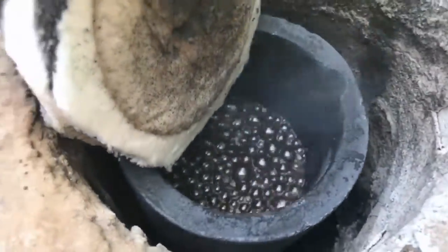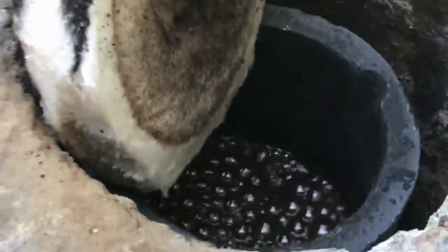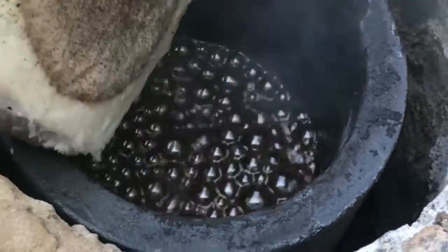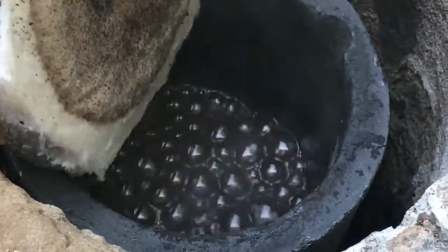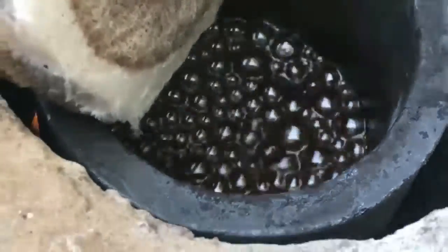As you can see here, this is what would happen when you boil all the water out of the solution — it turns into this material no matter what. All the water has boiled out and we are now down to a solution that's about 200 Celsius, where I am holding it as instructed.